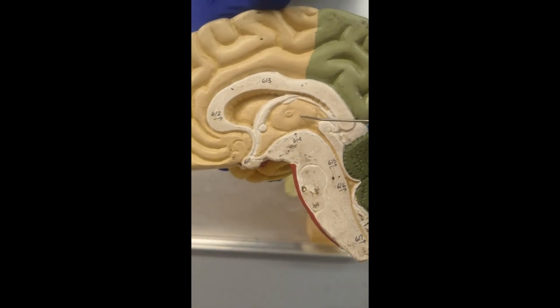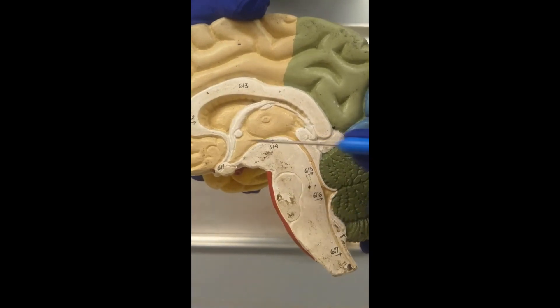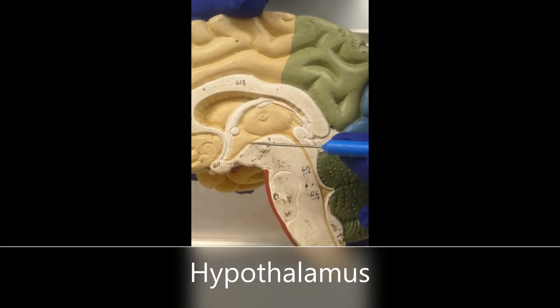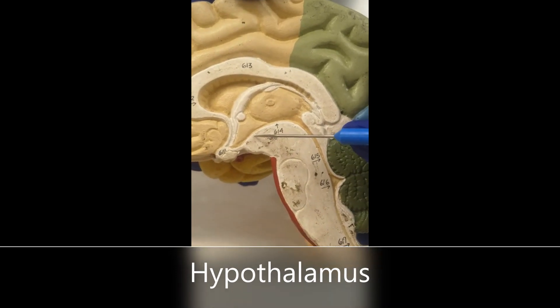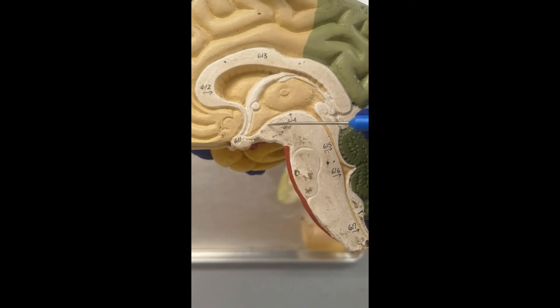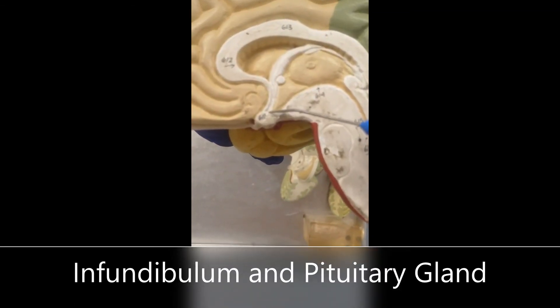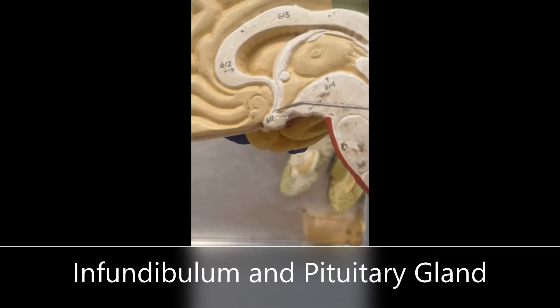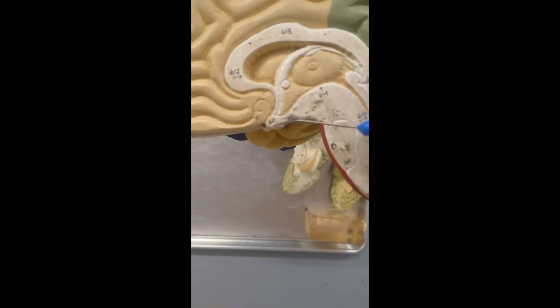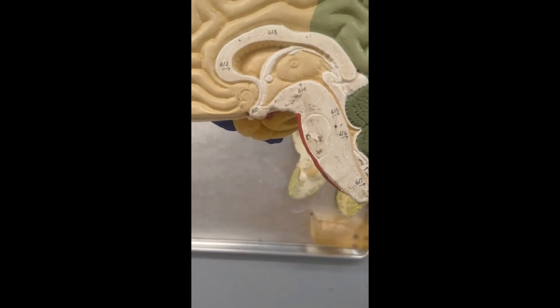The hypothalamus — 'hypo' means below, so the hypothalamus is going to be below the thalamus. What we're looking for here is the infundibulum and the pituitary gland. The infundibulum is a little stalk that the pituitary gland sits on, and then the pituitary gland or hypophysis is located at the end of that stalk.